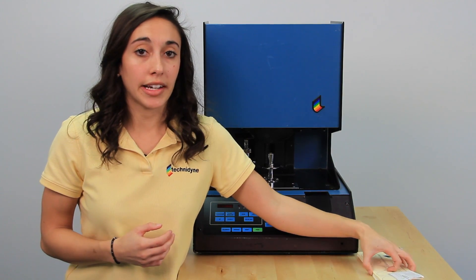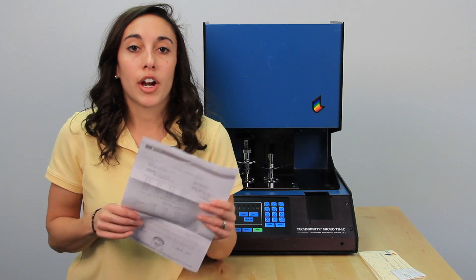Now 70 is your primary calibration standard, and on it you'll find five sets of data for brightness, as well as the color data Rx, Ry, and Rz. The other thing you'll find in your calibration kit are your traceability and your verification forms.